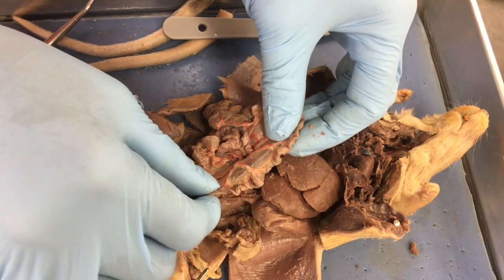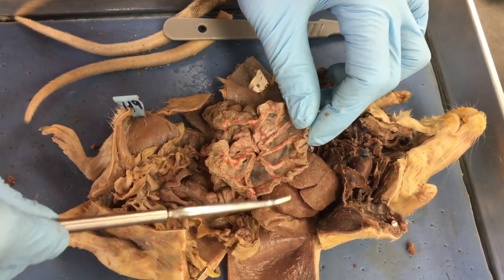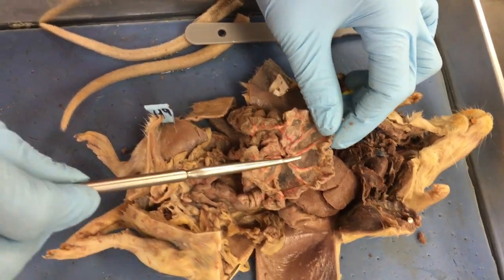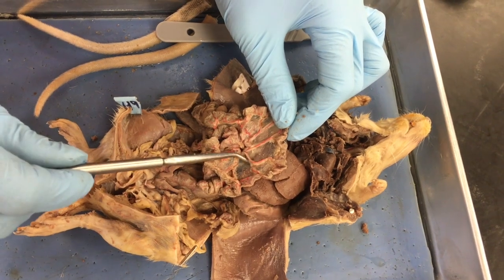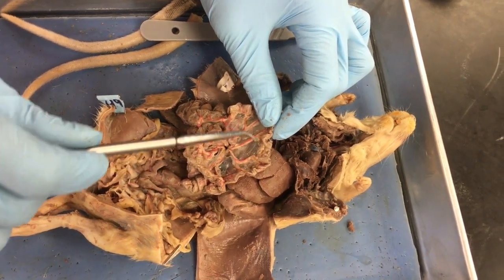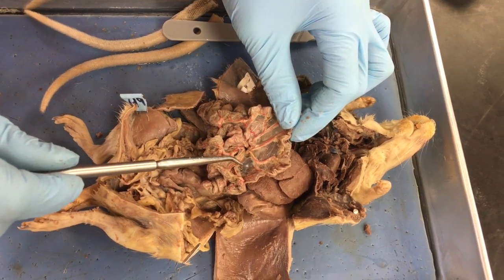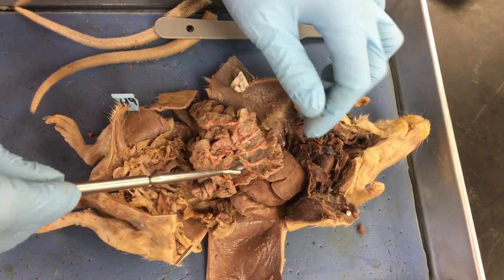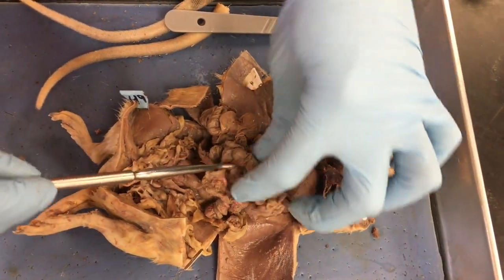And then the goo that holds it together, do you guys remember hearing about the new organ they discovered in the human body? No. Well, they claimed to have discovered a new organ, which really wasn't a new organ. It was this stuff. It was mesenteries. We've always had mesenteries. We've always known they were there. We're calling them an organ, so they just got a new name. They were always there. So the mesenteries hold that small intestine together. So small intestine, small intestine.